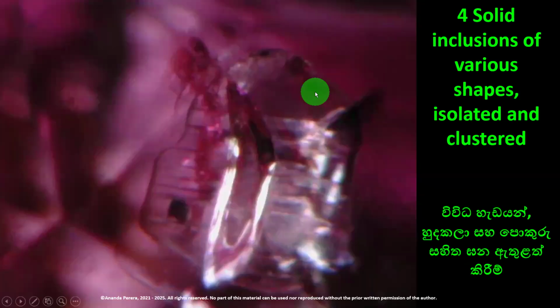Here we can see various shapes. Various shapes inclusions. Arrangements are here. It is also Namya ruby. This one, it is not liquid or gas inclusion. Not two-phase inclusions. It is solid inclusions of various shapes, isolated and clustered. All the solid inclusions are clustered together. It is Namya natural ruby.